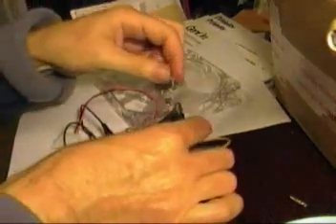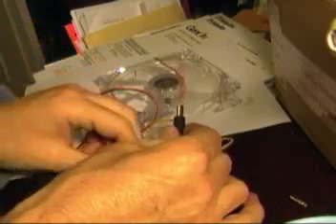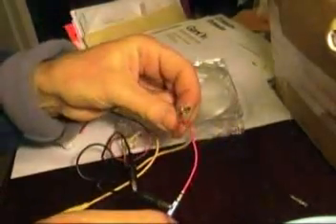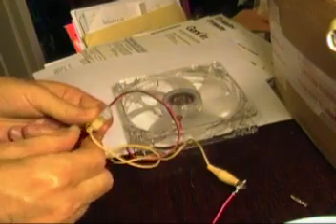Here I'm just checking the continuity, or checking the polarity of the fan. I'm going to connect this up. The power supply is plugged in, and I'm going to connect up the fan temporarily using some alligator clips to see that I've got it right. Basically it's pretty easy — the red is the plus and the black is the minus. I just wanted to make sure the fan worked with the power supply. I was a little concerned because it didn't come right on, but there was a loose connection.